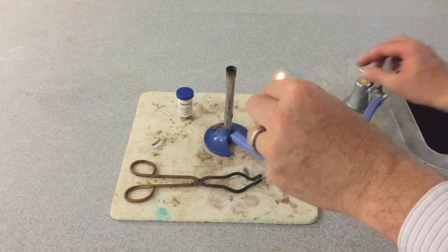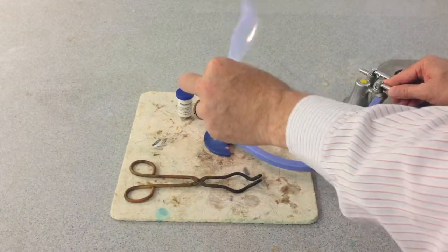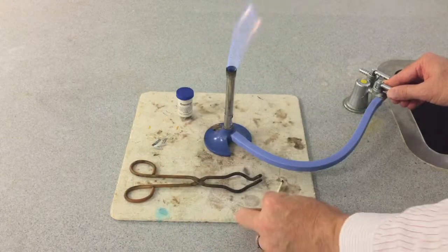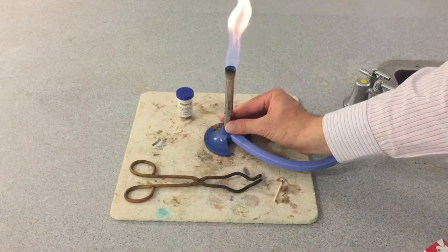The burning magnesium experiment is a teacher-only demonstration. First, we need to light a Bunsen burner and set it to the hottest flame.